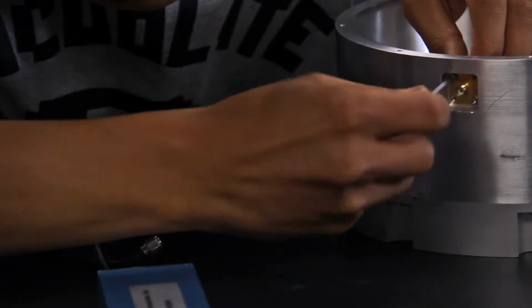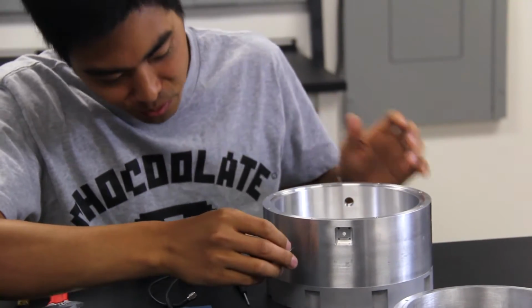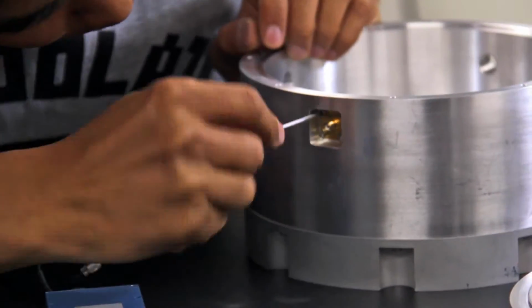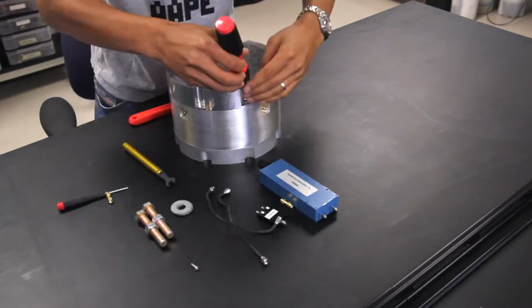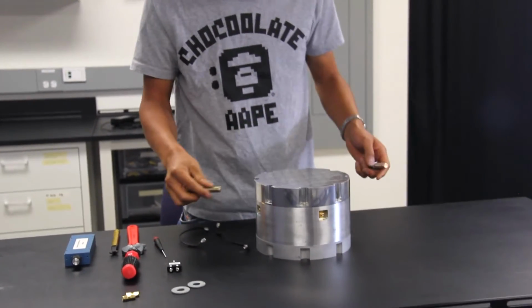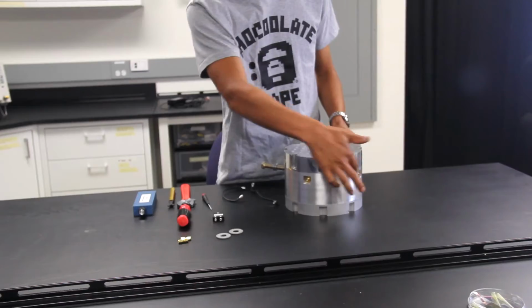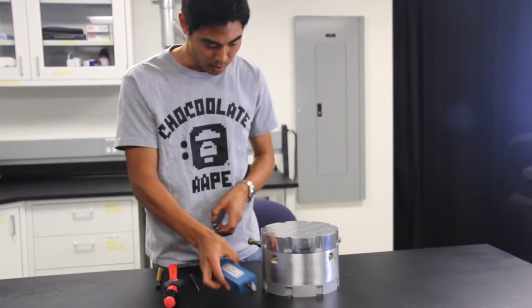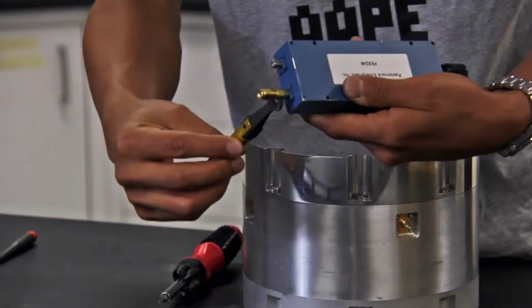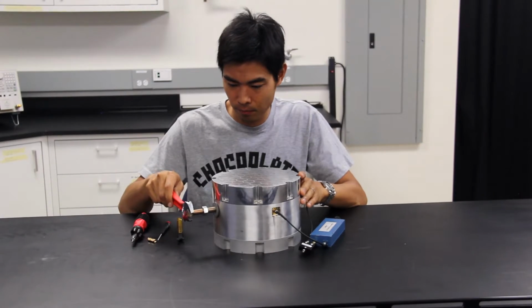Okay, so next let's put in the excitation source. One more, because we need to generate circular polarization. In order to make the circular polarization, we should control the cavity's frequency and also put a 90 degree phase shift on the excitation. How to do that is we use the phase shifters and they combine together to one point. Okay, tighten up, and this is it.